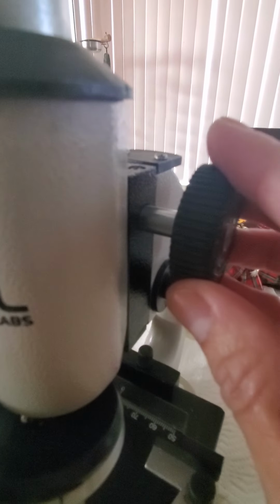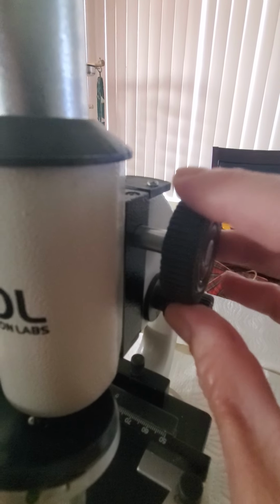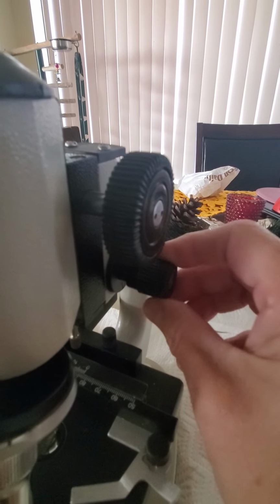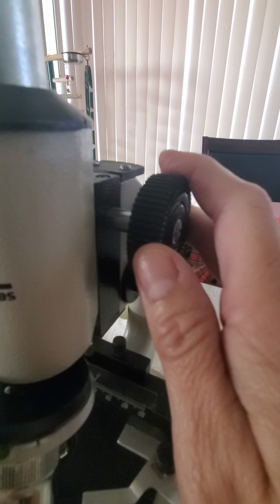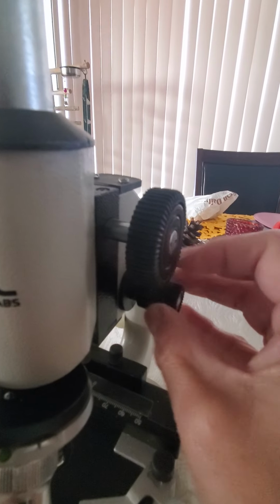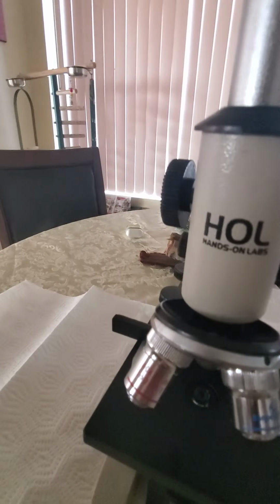Clips of the stage. Now, a part that I love is the coarse adjustment. Basically, the coarse adjustment allows you to clear your view, to put it closer, to put it further. And the fine adjustment does a fine focusing. So coarse adjustment moves the stage up and down to focus your view better. And the fine adjustment is a fine focus that can intensify and make the picture that you're looking at more intense.